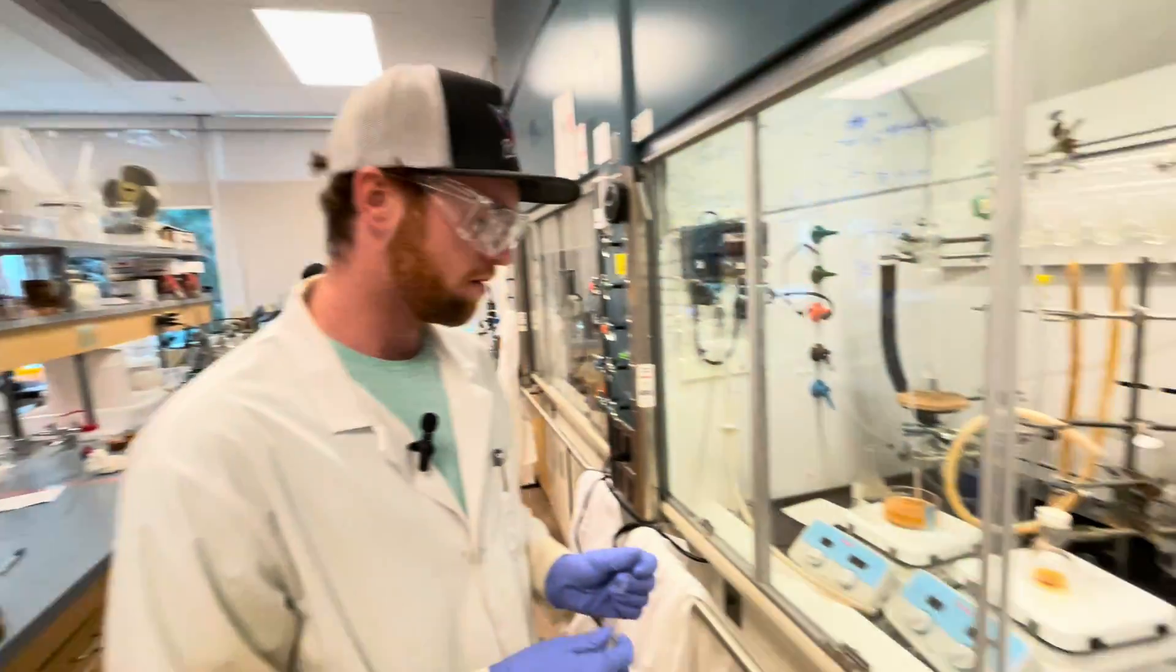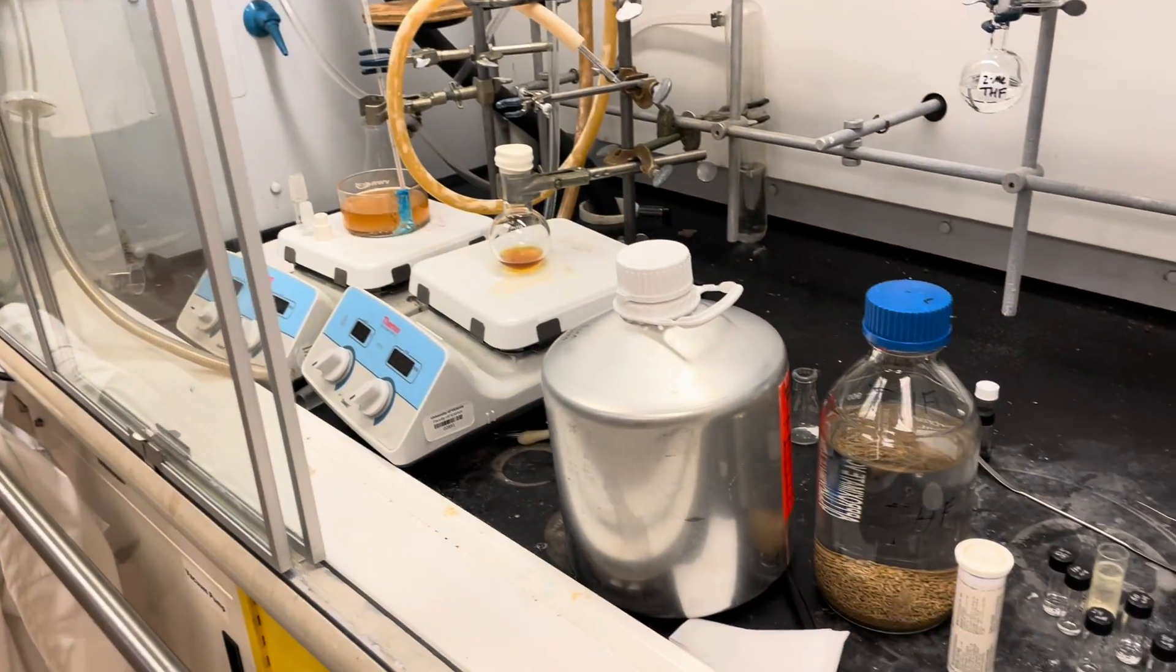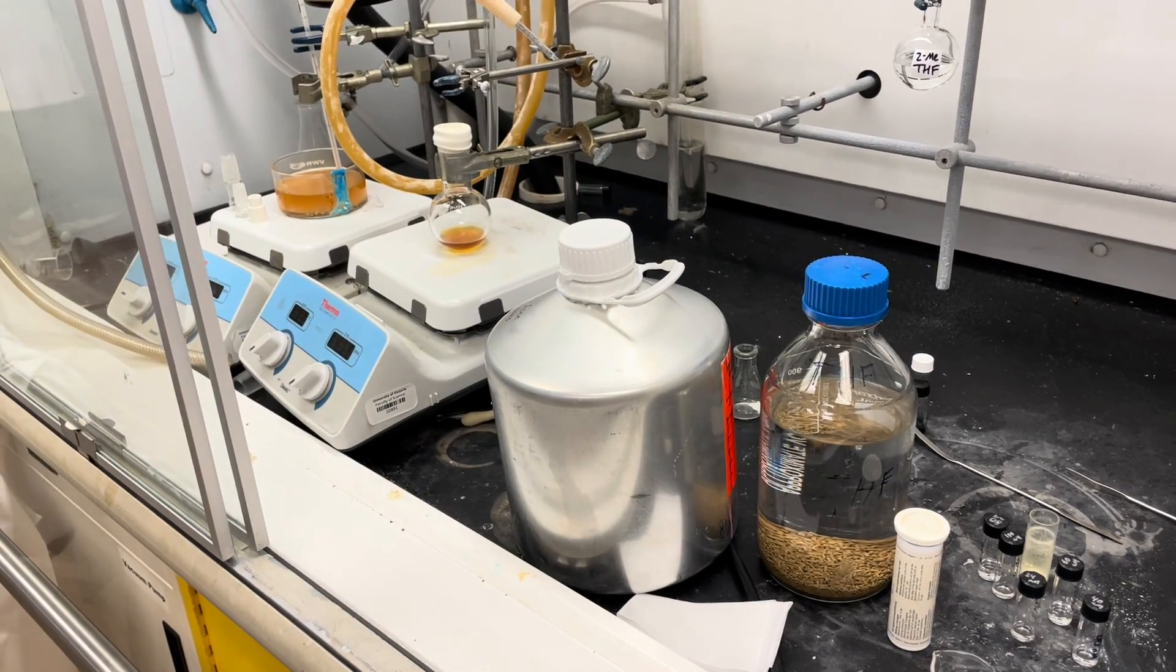So we've got two solvents here that we're going to test. One in this can is diethyl ether and then one in this media bottle is tetrahydrofuran.